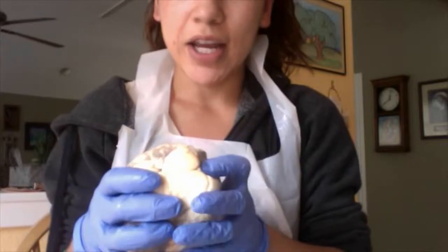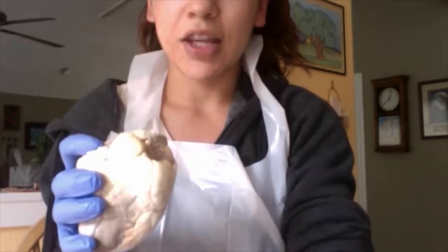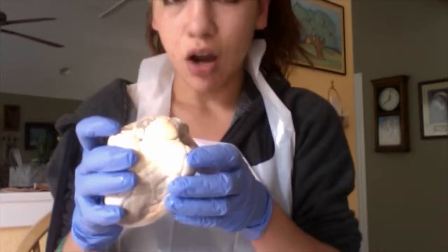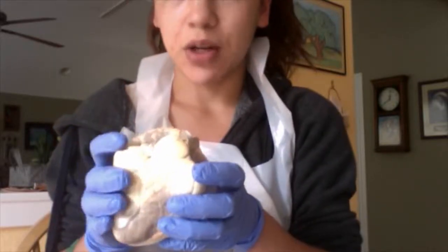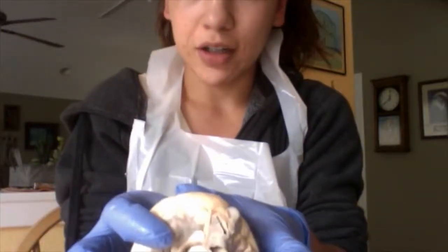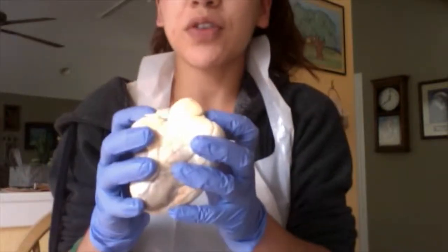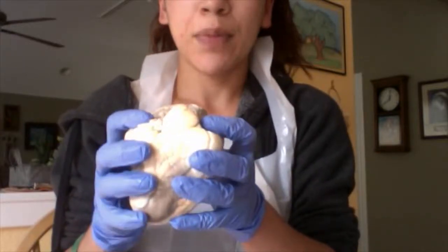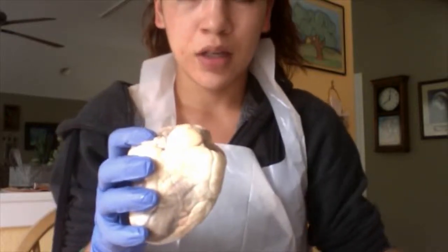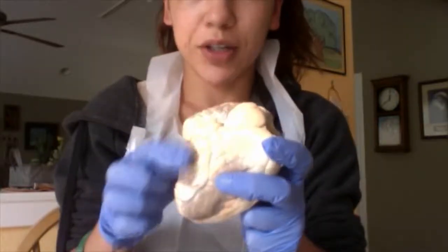There is a right atrium and a left atrium here, right and left. The blood in the right atrium is deoxygenated, and the blood in the left atrium is oxygenated. Here I have the right auricle and the left auricle, this kind of grayish brown tissue here. The auricles function to increase the capacity of the atria, to increase the volume of blood they can contain. Then inferior to that, I would have the right ventricle here and the left ventricle here.